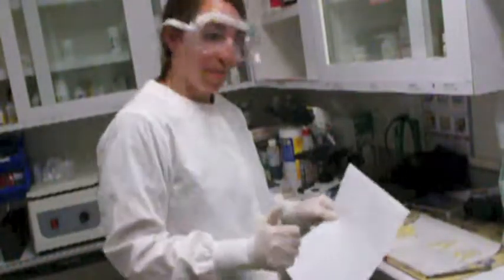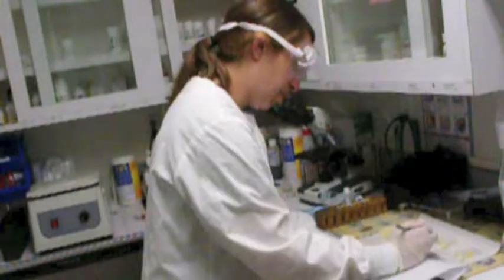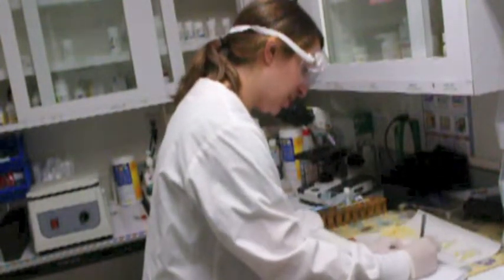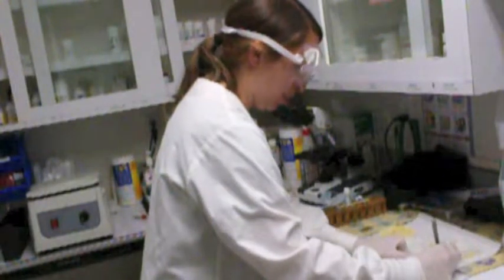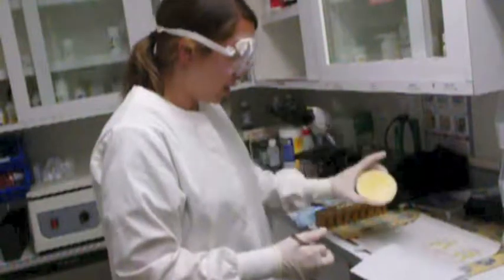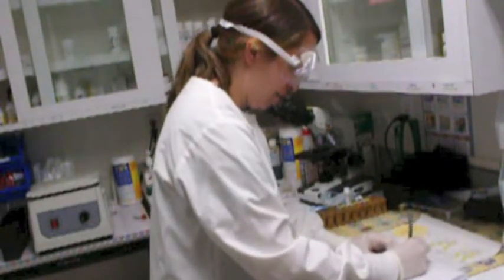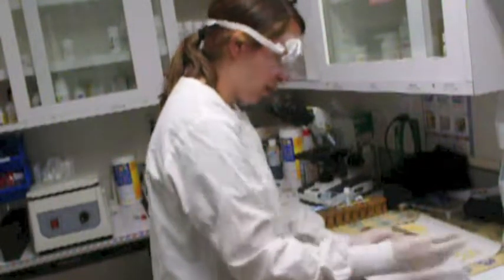So I'm going to report my findings. I just have a new page from the patient's chart. So I'm going to write after 24 hours, there is growth. I'm going to write the change to this brownish, reddish color. Brown, red color. Okay. Just going to place this over here.